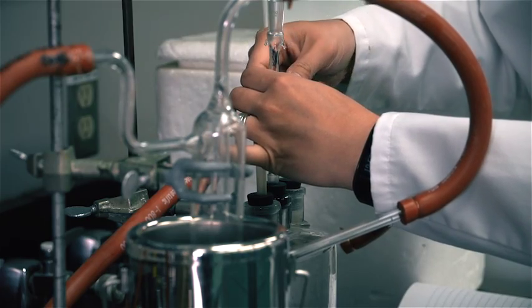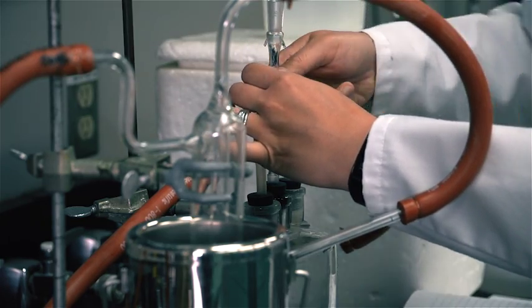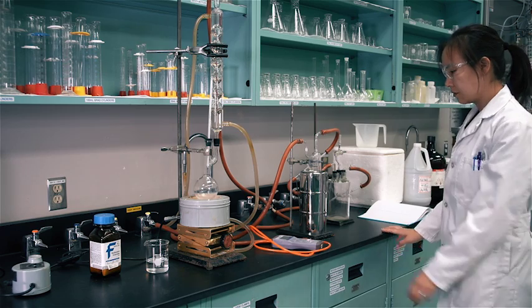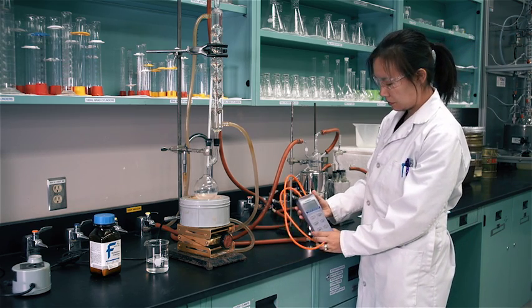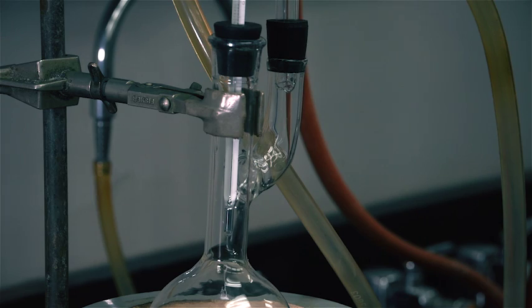Open the stopcock on the safety bottle to admit enough air to stop the boiling. The manometer reading should drop by 30 to 50 millimeters of mercury. Continue heating until a new boiling point is reached and recorded.